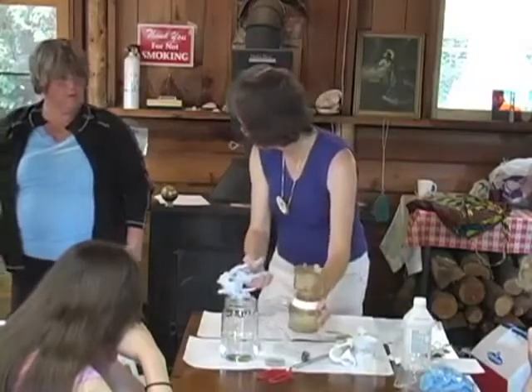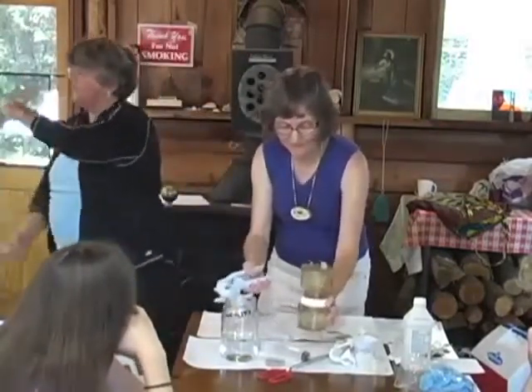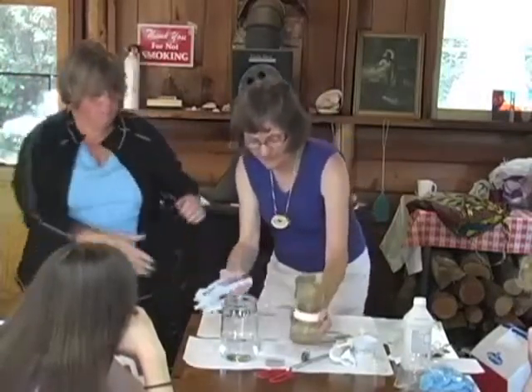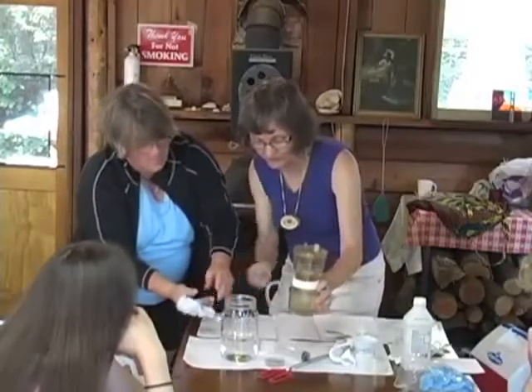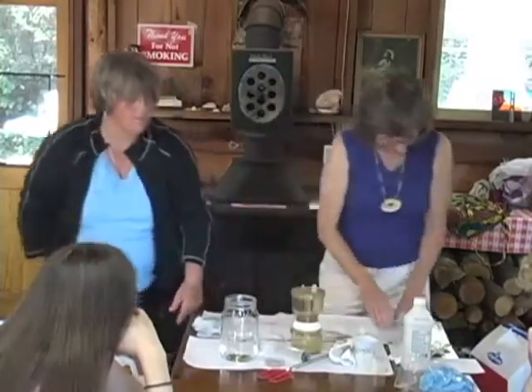Which I never understood. It's so that you keep it moving so that it's pulling down through the filter and you're not having water stand on the side and just the middle go down. And you don't want to pump too much once it's pretty much dry. You'll tear the paper if you go anymore. Are you through? Yeah, I'm through. Okay. All right.